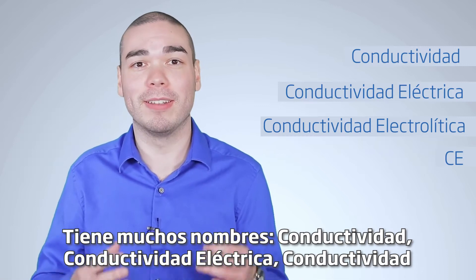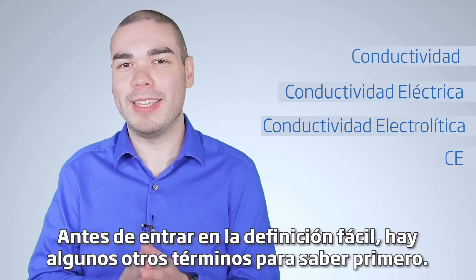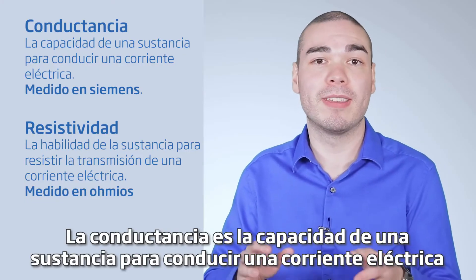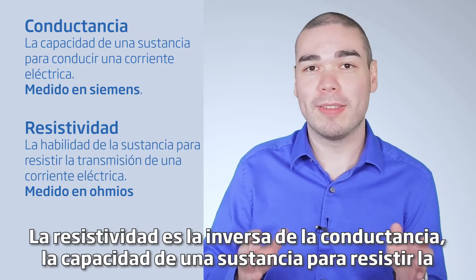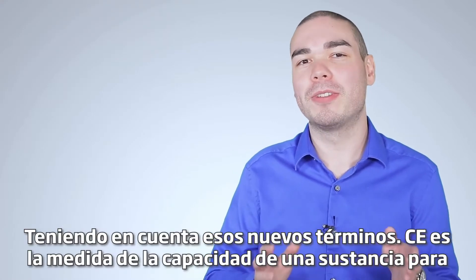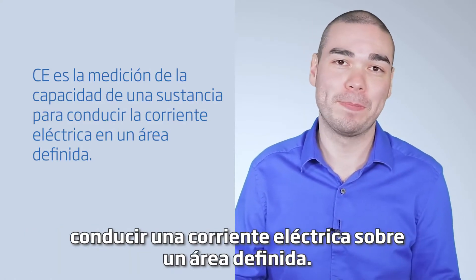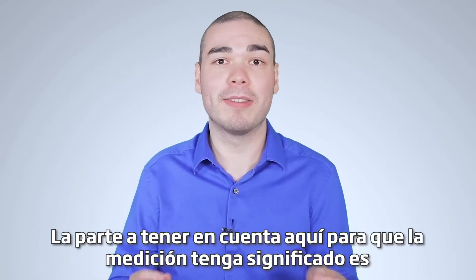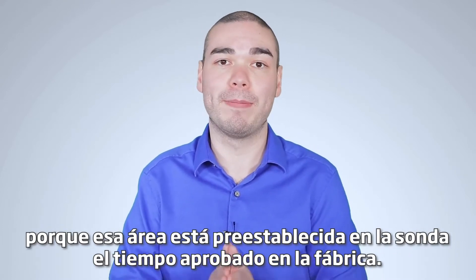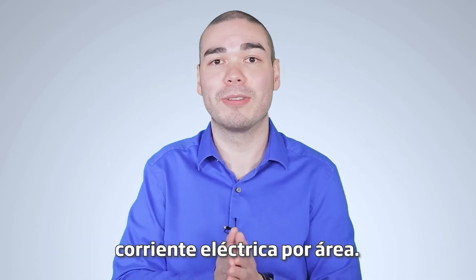EC goes by many names: conductivity, electrical conductivity, electrolytic conductivity, EC — but they all mean the same thing. Conductance is the ability for a substance to conduct an electrical current, measured in Siemens. Resistivity is the inverse of conductance — the ability of a substance to resist transmitting an electrical current. EC is the measurement of the ability of a substance to conduct an electrical current over a defined area. This defined area is also known as the cell constant, because that area is preset in the probe via probe type at the factory. That's why conductivity is measured as the ability of the substance to conduct an electrical current per area.